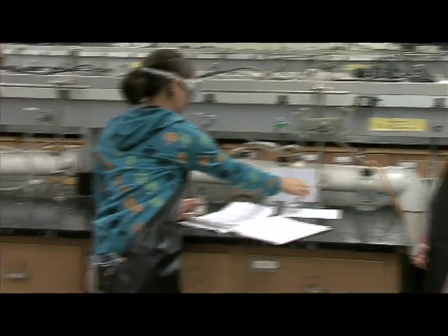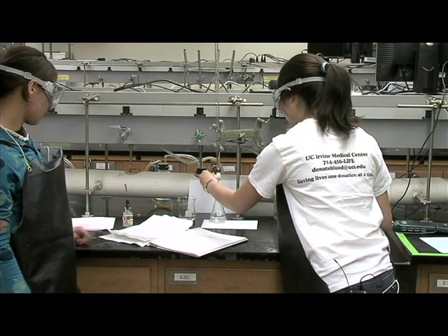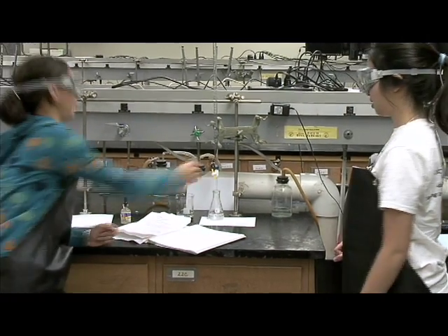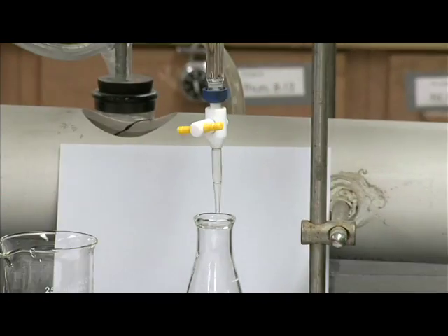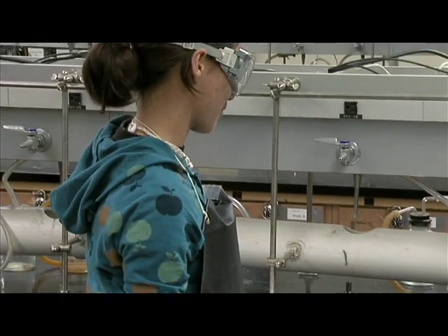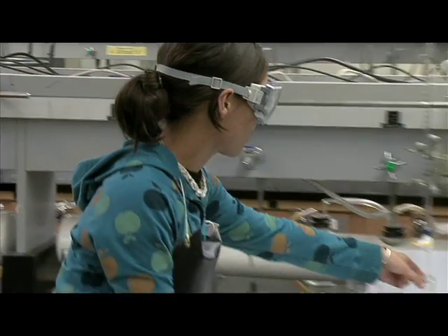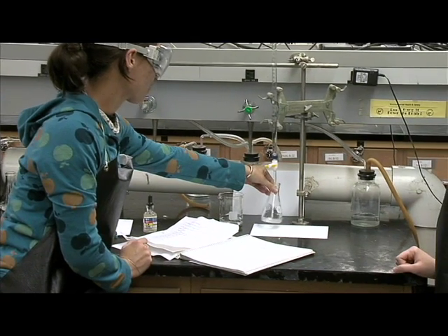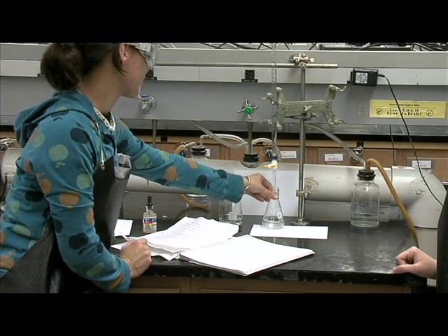Okay, can we start now? Uh-huh. Okay, hold on a second. We can start by letting the titrant out quickly, but once it nears the endpoint, we have to slow down. And don't forget to swirl the flask. That way, all the analyte will be exposed to the titrant. Yeah, yeah, I know.